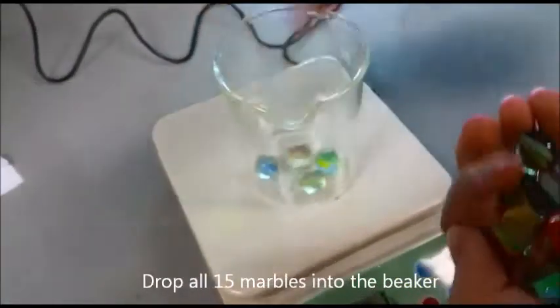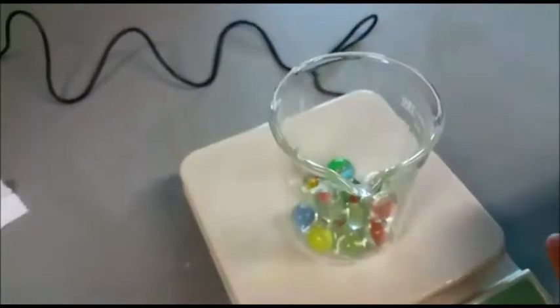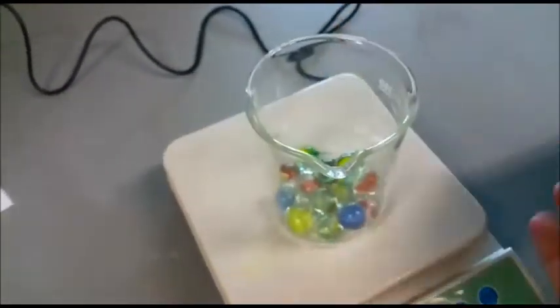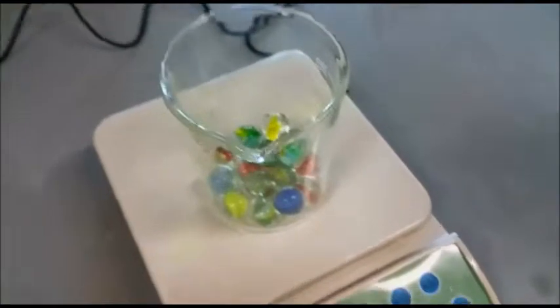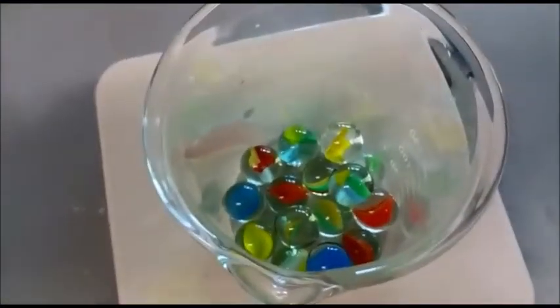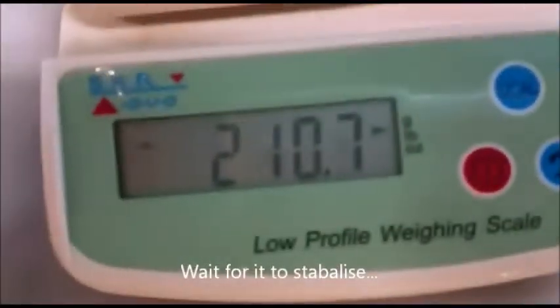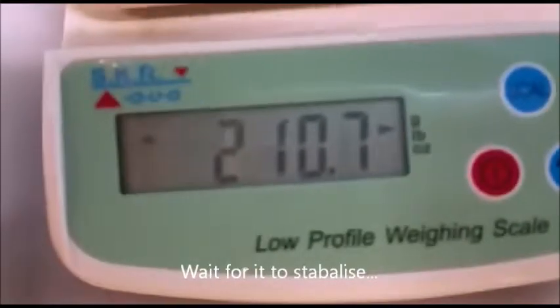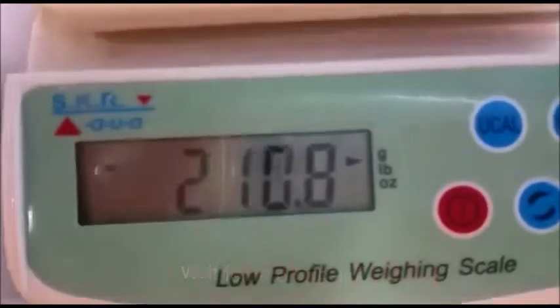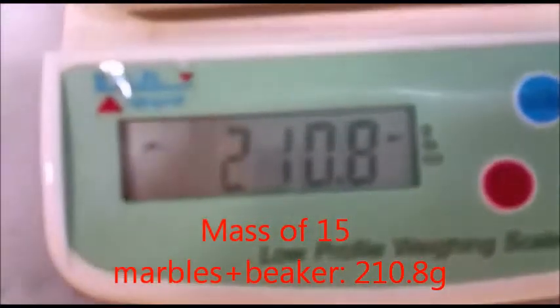Drop all the 15 marbles into the beaker. Wait for it to stabilize. Mass of 15 marbles plus beaker is 210.8 grams.